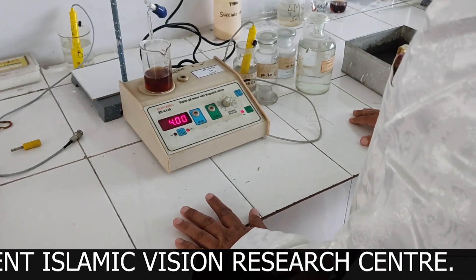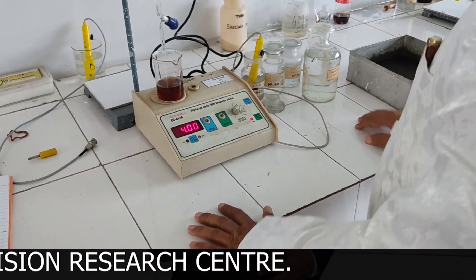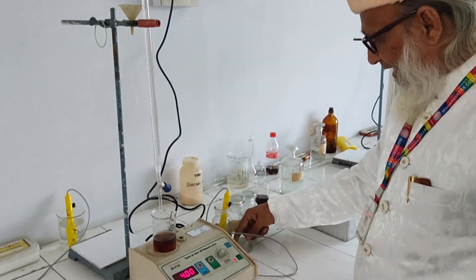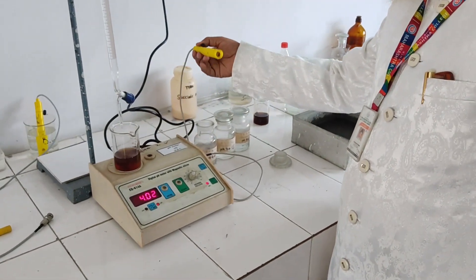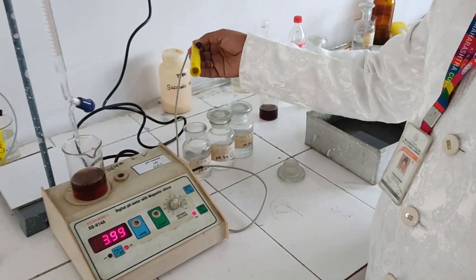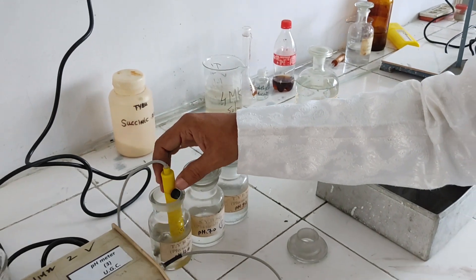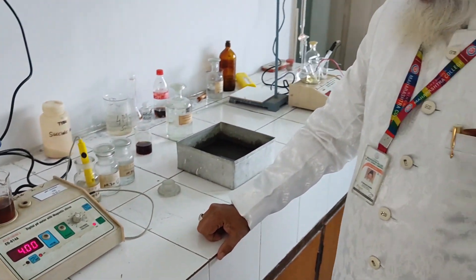Now we have to standardize our pH meter. This is a combined electrode — calomel electrode and glass electrode. It is called a pH electrode.